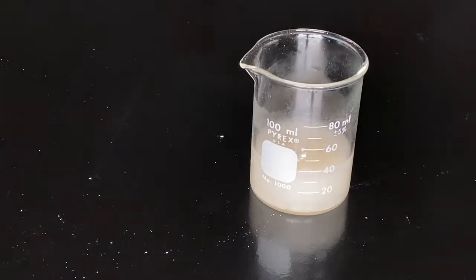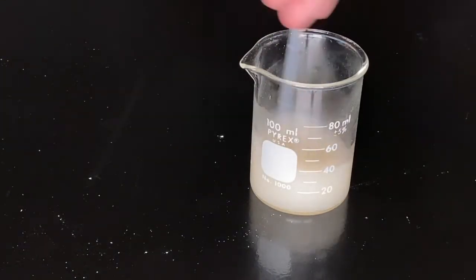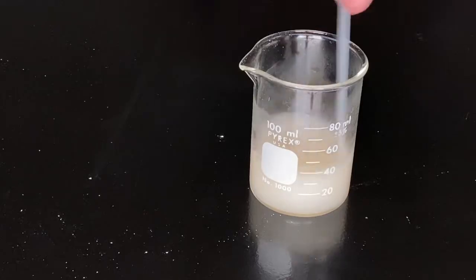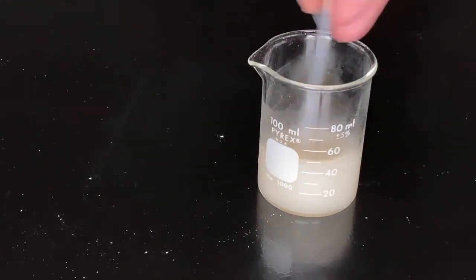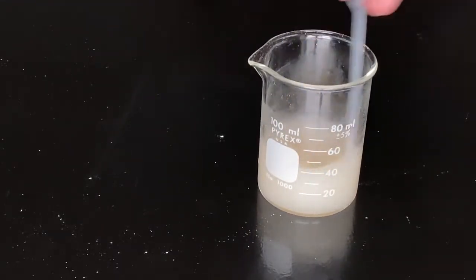After stirring your sugars into your beakers, you'll need to let your yeast mixture sit for a little while, probably about 15 minutes or so. This will give the yeast a chance to wake up and get to work metabolizing those sugars.